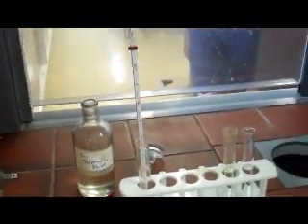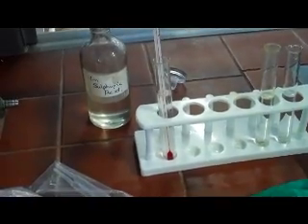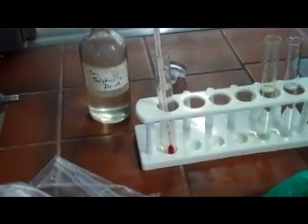Is that an exothermic or an endothermic reaction? This one's an exothermic. Yep, definitely. Exothermic reaction. And if you feel the temperature, you'll notice that it's quite warm. You won't be able to feel it through the gloves. But water and sulfuric acid releases heat and is an exothermic reaction.